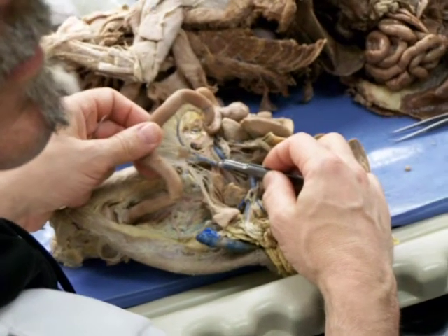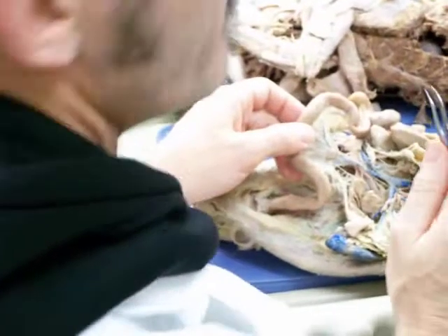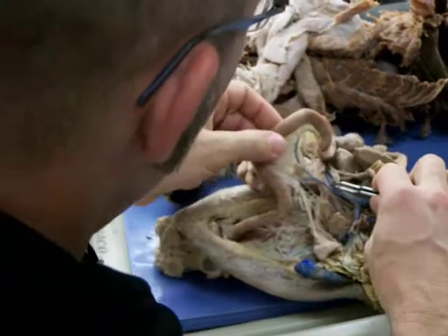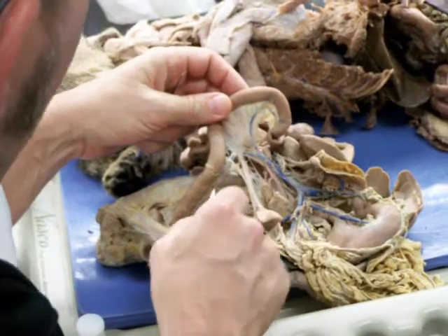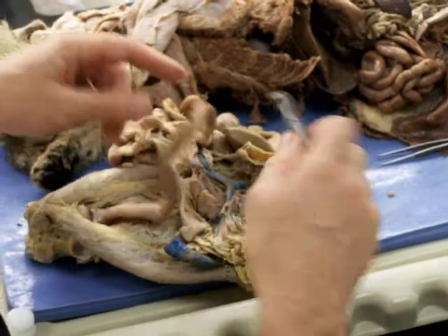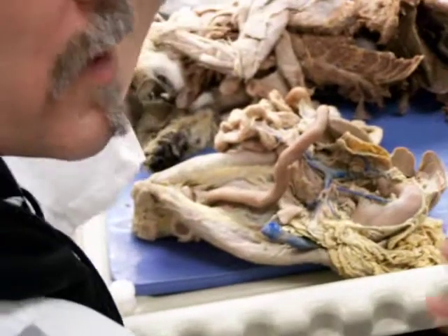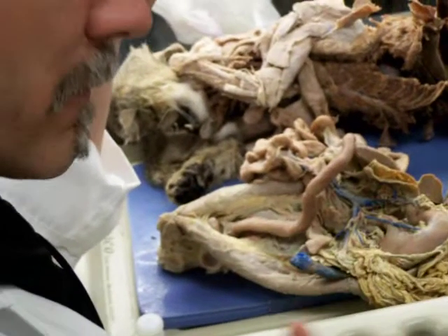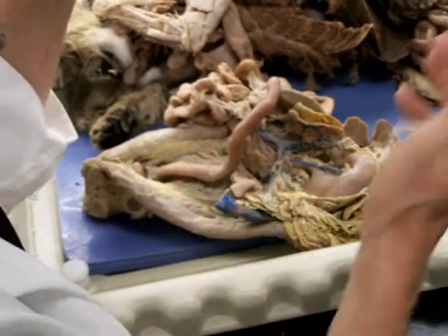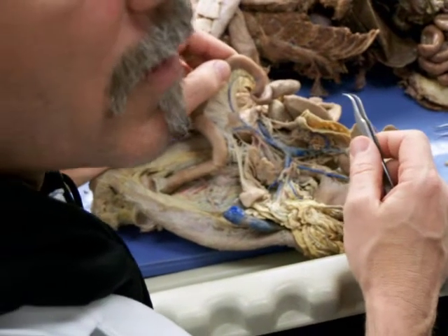So those two kind of run together, like the cranial and caudal mesenteric? The caudal mesenteric vein dumps into the cranial mesenteric vein. Okay. And they're called that because the caudal mesenteric vein is draining the area supplied by the caudal mesenteric artery. And so that's where the venous supply is all going up toward the liver, and the arterial supply coming up from the aorta at these three spots. That's where it gets confusing because they give the vessel the same name even though it's going away from the caudal mesenteric artery.